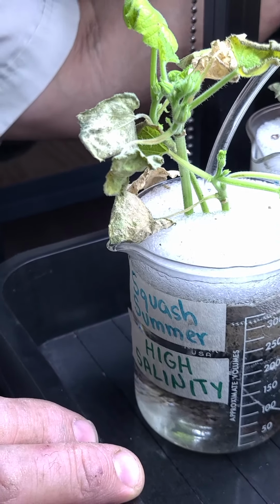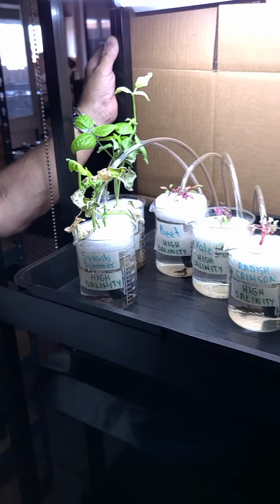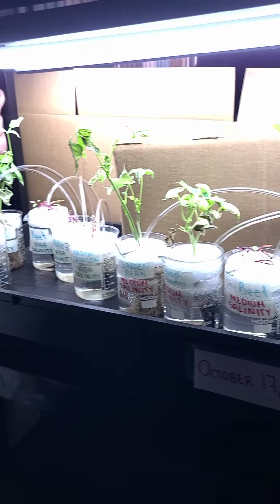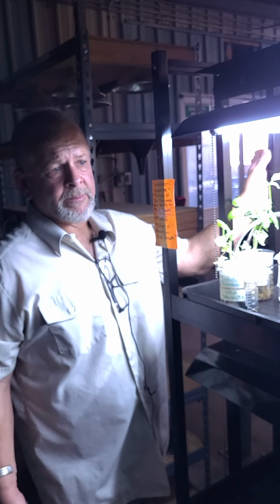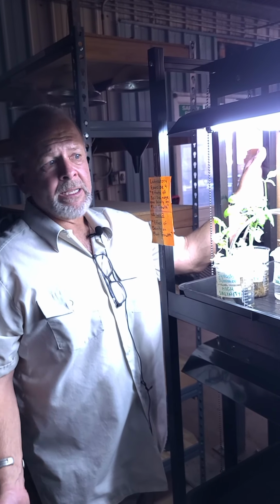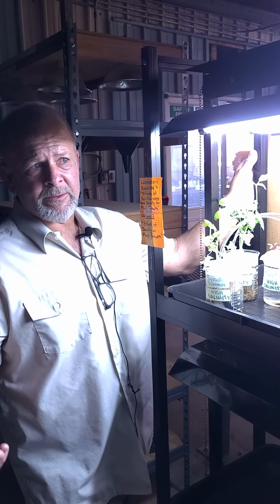So what we'll do is we'll go ahead and run this for another week, and at the end of that we'll see. We've already seen some results after 1 week. Let's see what happens after running this for 2 weeks, and then we'll be done. But I think we're already seeing some really interesting results from salinity. We've got all those different species. It's really quite interesting. So let's give it 1 more week.